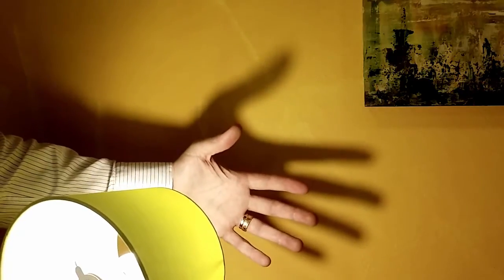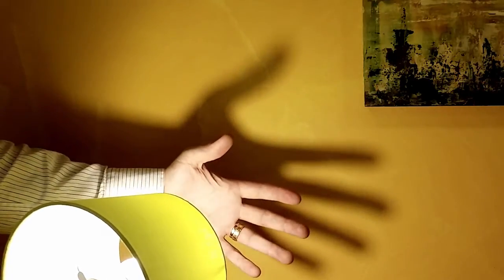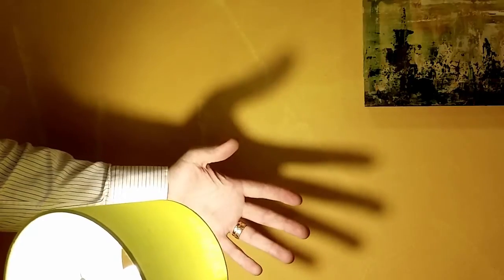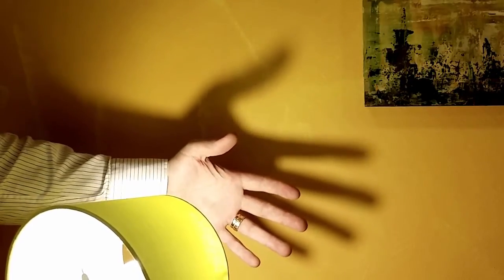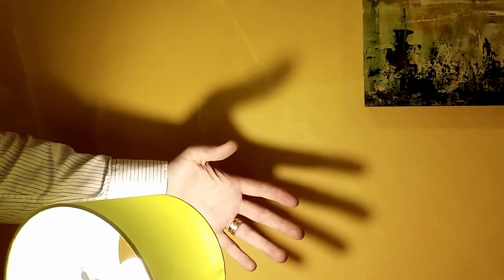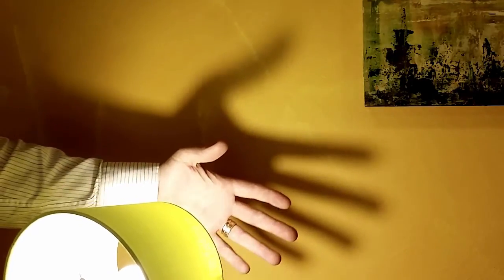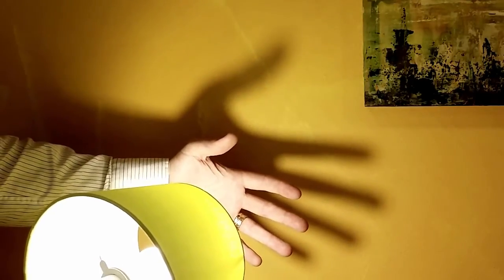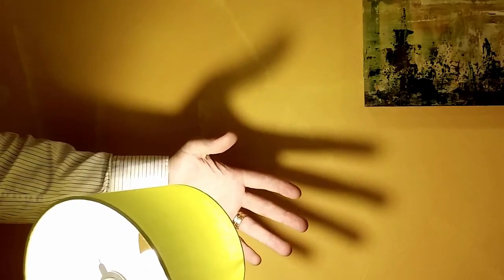Look at this. Here I put my hand between this lamp and the wall. On the wall we can see the shadow of my hand. You can also see that the shadow is magnified compared to the real size of my hand. So this is a magnification — the most fundamental microscope that you can make.